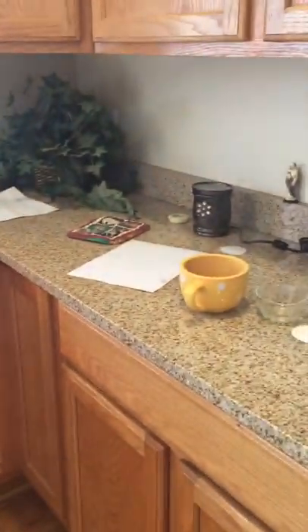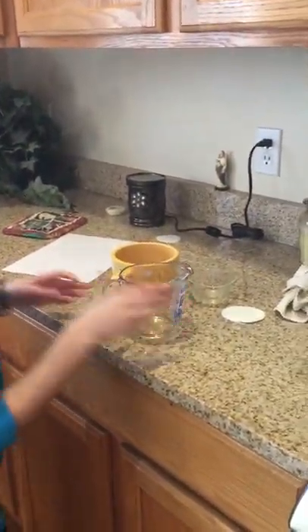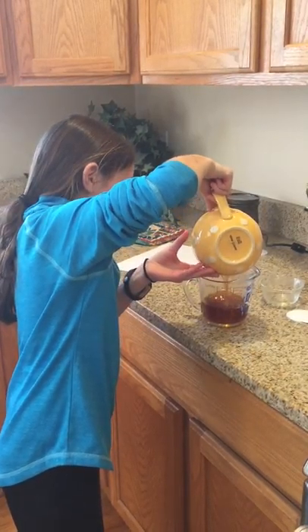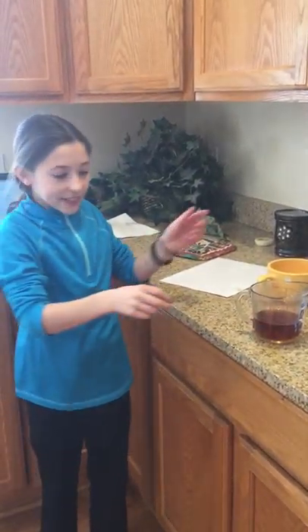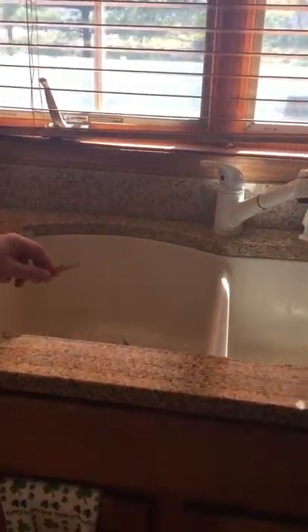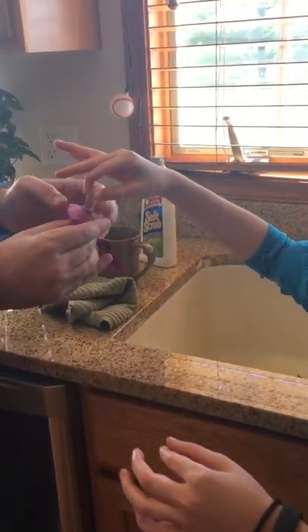And then you're going to put this in the sink so it can dry. And then now you're going to pour this into the measuring cup — you're going to pour it very carefully. So now that you have that, you're going to need a test tube. You need to make sure that you don't touch it because you don't want fingerprints on it. So you're going to pour a little bit into it, and then you're going to put it over here.